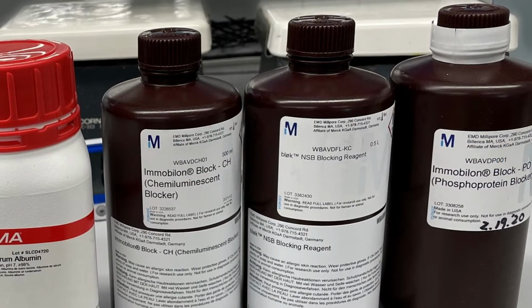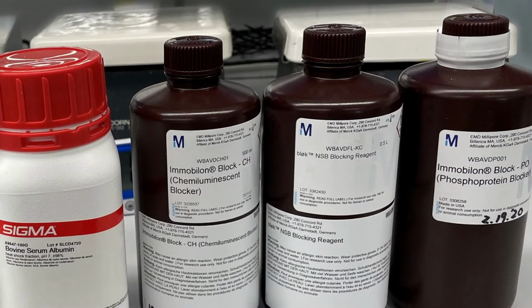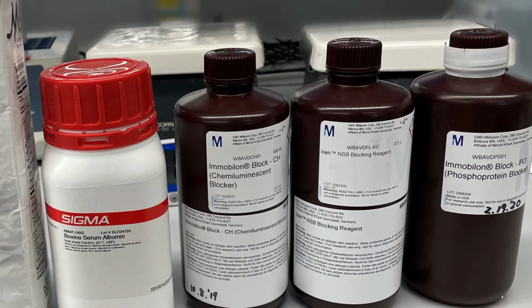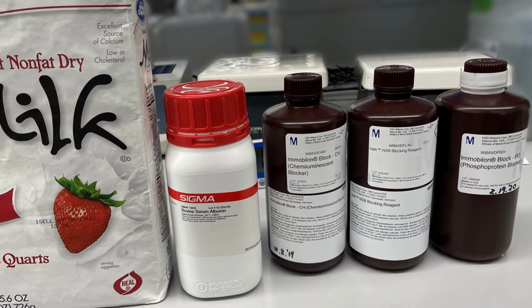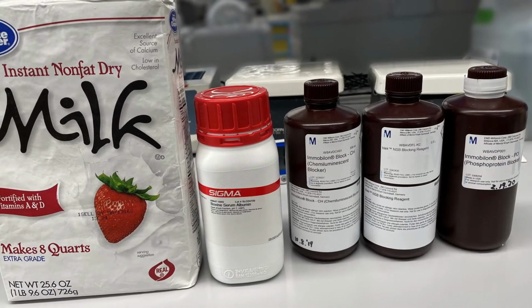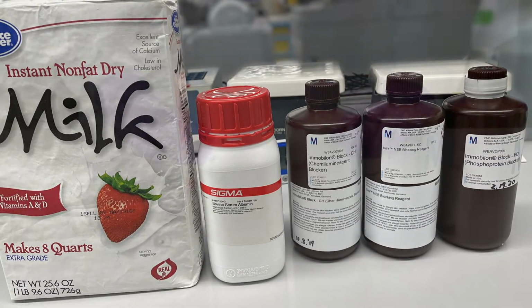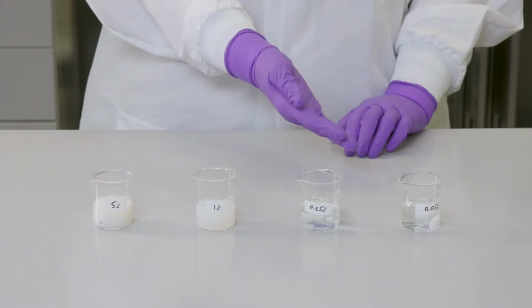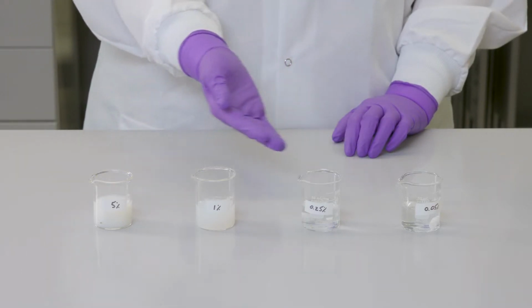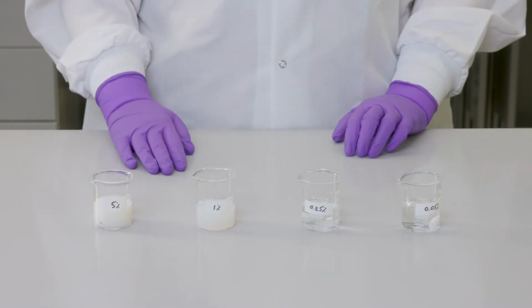Protein blocking is a key step to prevent background in western blots. Blocking buffers can be made with protein-based solutions, including non-fat dry milk, BSA, and specialized products like our western blocker solution. Every antibody should be tested to find the right concentration of blocking agent, but for most applications, the amount of non-fat dry milk needed will fall between 0.05 and 5% by weight.